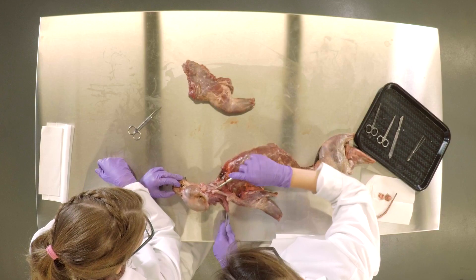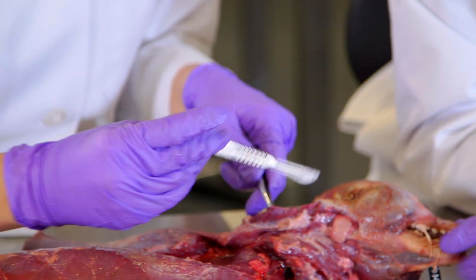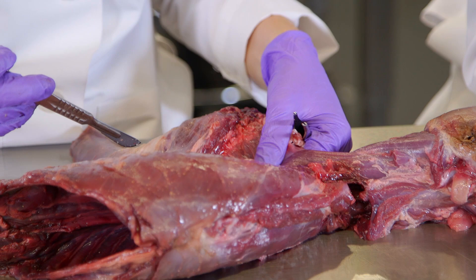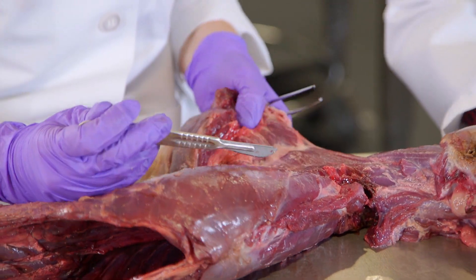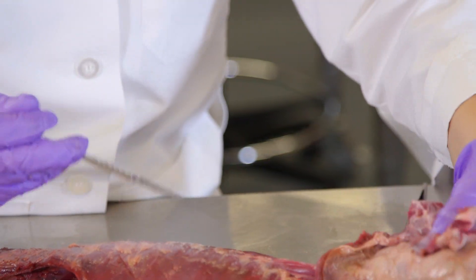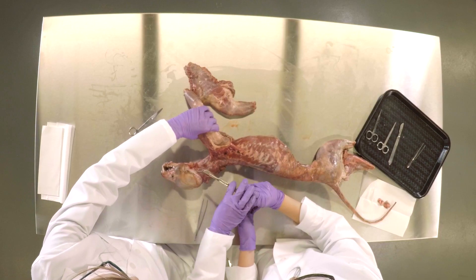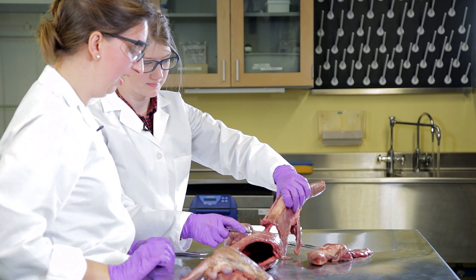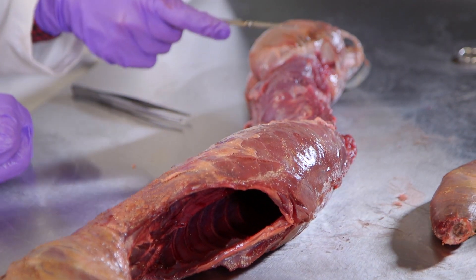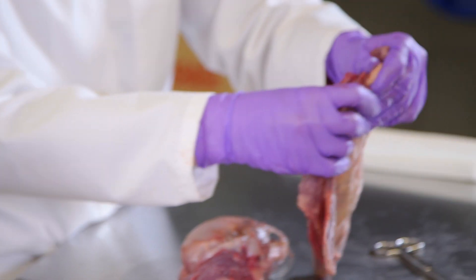People think dinosaurs are cool, but really mammals are much cooler — you're going to start some stuff in the comments of this video. Only the serratus is left, so hold it and run your scalpel, cut that, and that's going to bring the limb off. Just like that — there you go, you have a limb. Two of them.